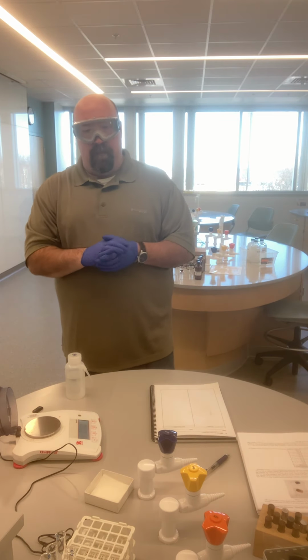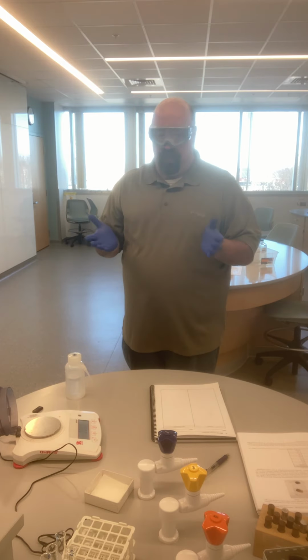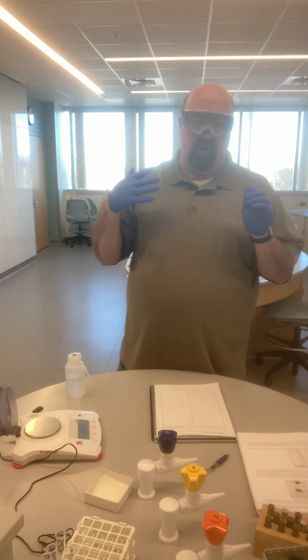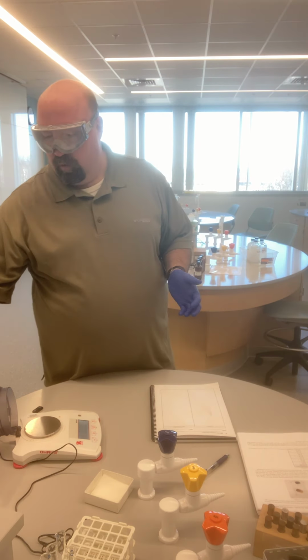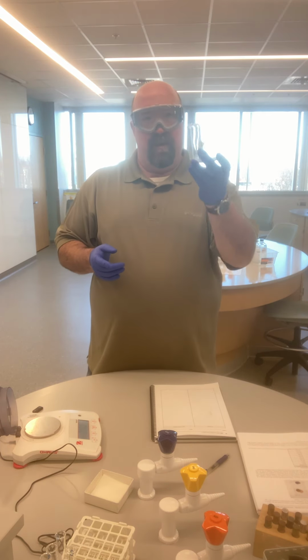And so Module 0, the whole idea behind this first lab in CHY 114, is to just introduce you to some of the different tools and different ways that we measure things in a chemistry lab. And so to just show you some of the different tools that we do use, things that you're maybe familiar with or you maybe have seen.